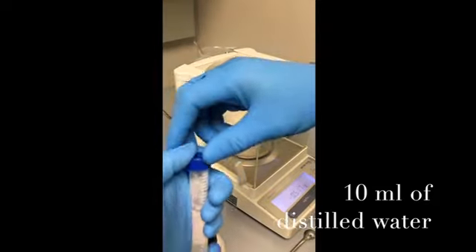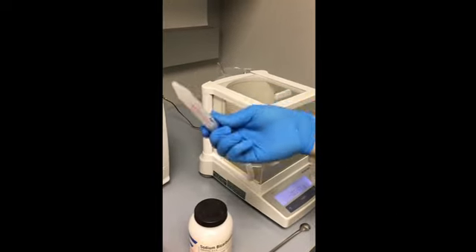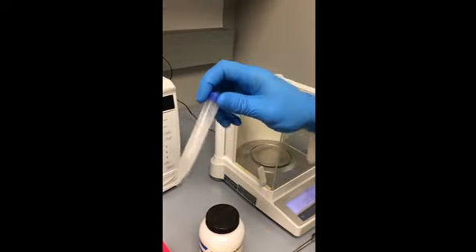For sodium bicarbonate, it takes a little bit of time and shaking in order to get completely dissolved. So you have to make sure to invert it for like 3 to 5 minutes to get completely dissolved.